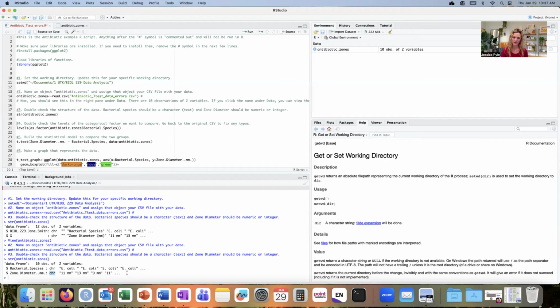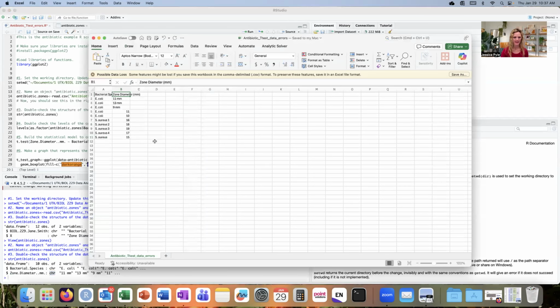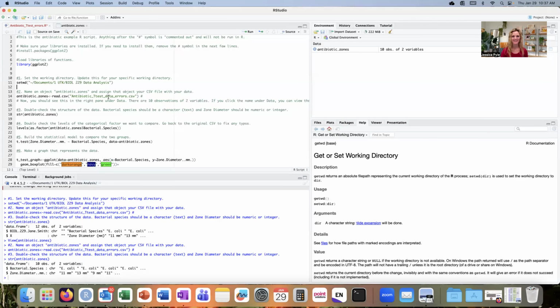So again, I'm going to reopen the file in Excel and make some changes. And I can see here my first few rows do have that space MM. So I can just easily delete that. I want to make sure that I delete the letters as well as the space, because if there's any space remaining, it will be interpreted as a character by R. Okay, so I've cleaned that up. Now all of my numbers do look like numbers. I'm going to save this file again. And when I come back into R, I need to reopen that file and recreate the object. So I have to go back to line 14 and run that line again.